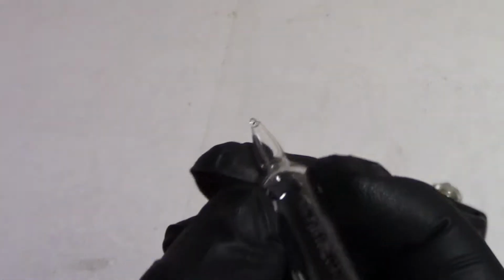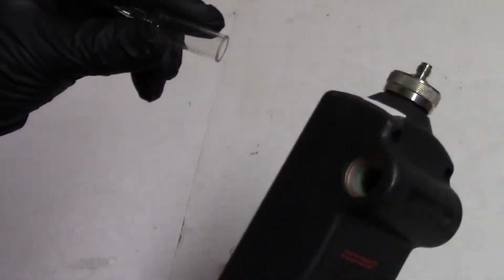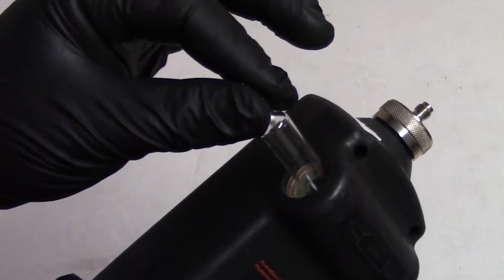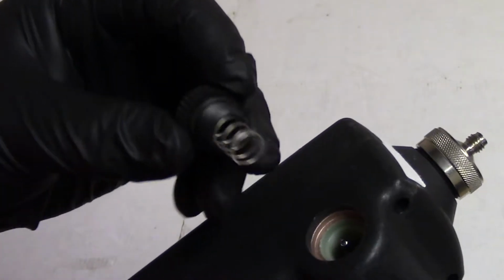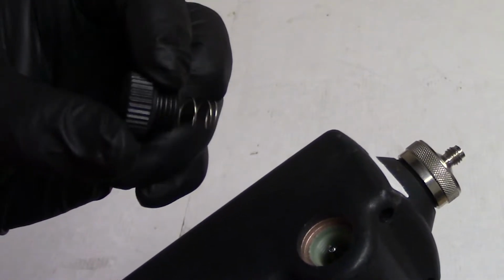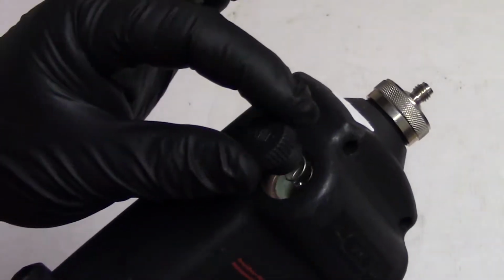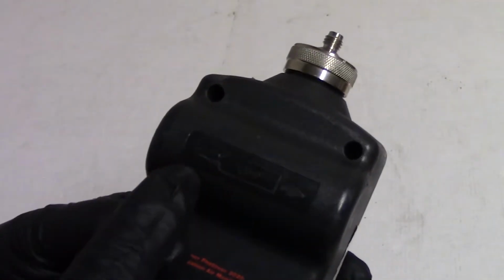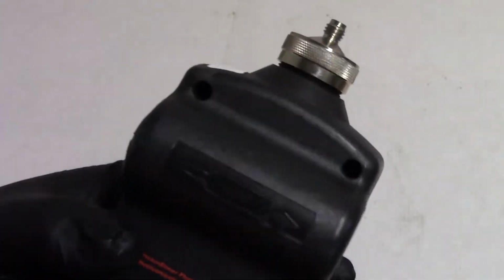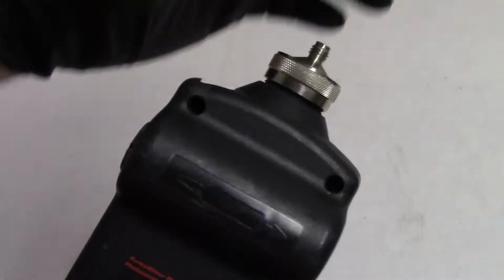But as you notice, there's no electrodes. I believe there's gas in here, and that gas is excited by some high voltage, probably in the bottom. Then it grounds out through here, I'm guessing, but I don't see any connections there either, and that rubber washer seems to indicate that this just seals up. So the spring's pushing down on that to hold it in place. I even have a little picture on the back to kind of show you. So that little tube emits UV light and shines through the sensor pack down there.